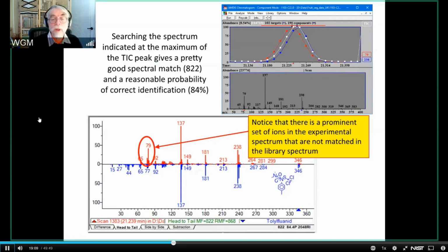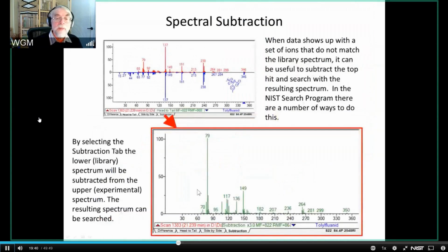And what you want to be able to do is use a larger library, including your own library, a library that you build yourself from standards that you have acquired or material that you have seized in various ways. And the way to do this, particularly in a situation like this, is to use the tool that's hinted at here, this little tab down here called subtraction. And that does a spectral subtraction. It basically takes the unknown, which is here in red, and subtracts the spectrum in blue that's the hit. It's not necessarily the hit, it's just whatever you're putting in that screen. It makes a subtraction of that, and it generates a new spectrum.